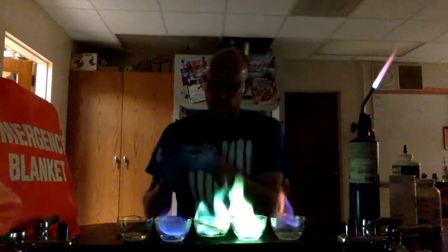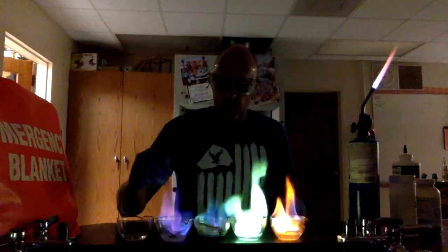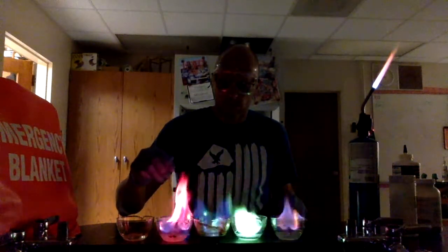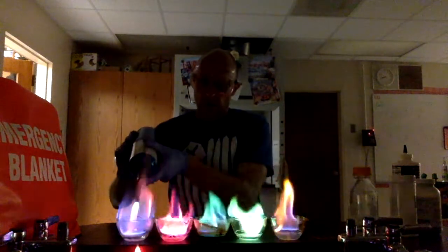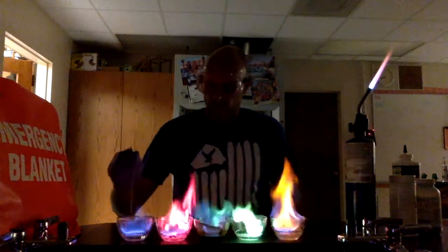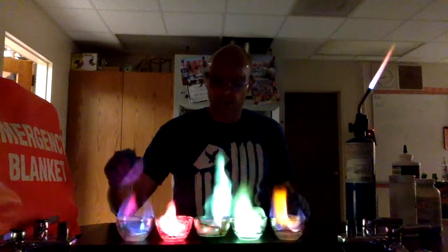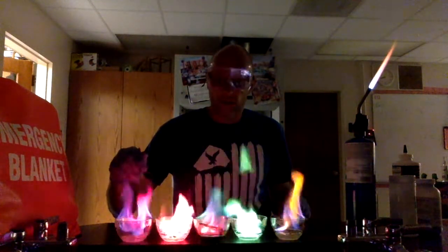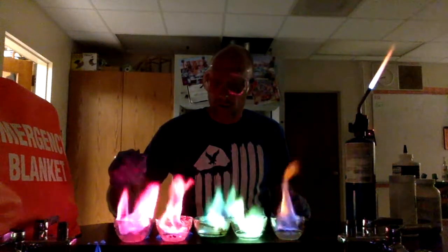Strontium chloride. And lithium chloride. Both lithium and strontium are red, but if you look closely you can see they are different colors of red.